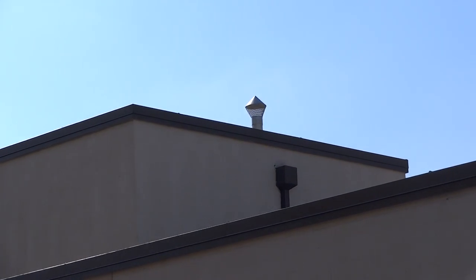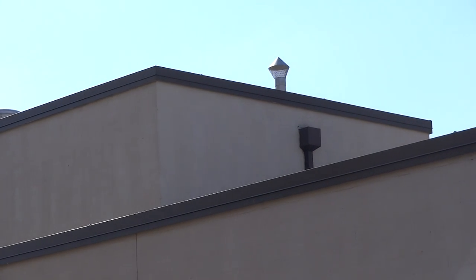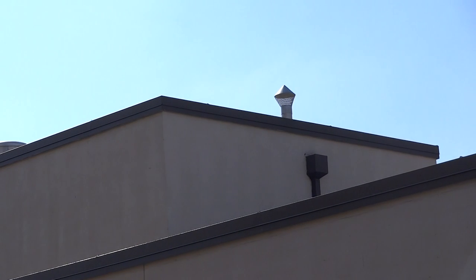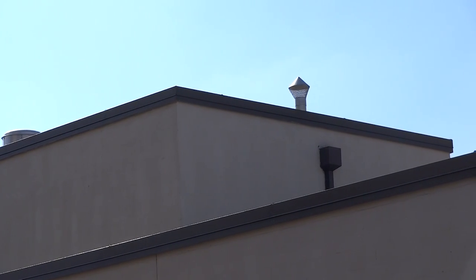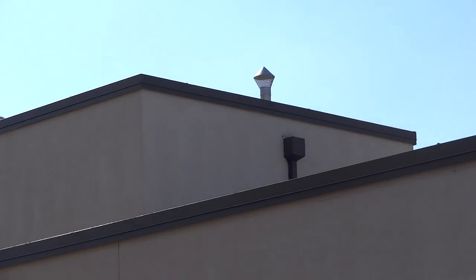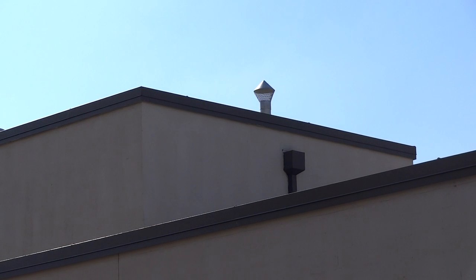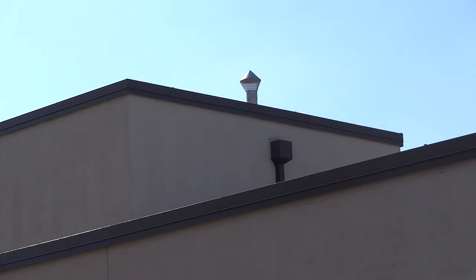Looking at a building. Staring at this windowless building with our cameras out. What's gonna happen? I don't know. Everyone else is standing, so I can't. It's a flash mob. Oh, there were people still inside.